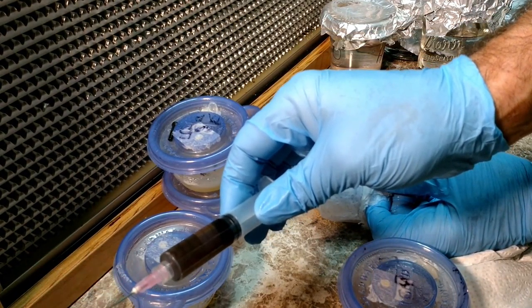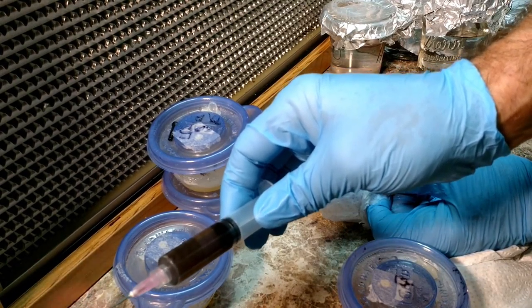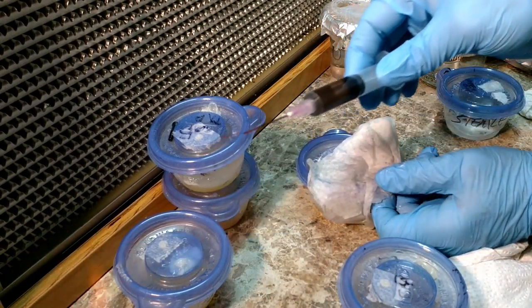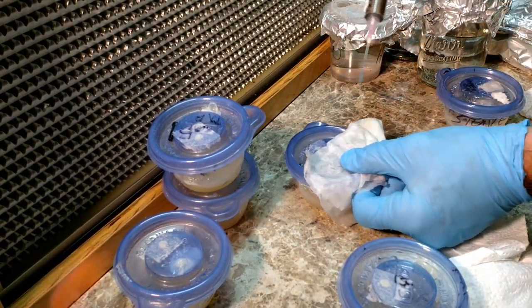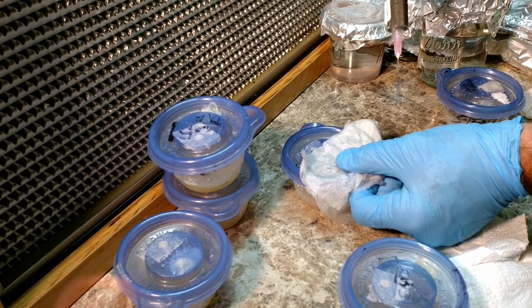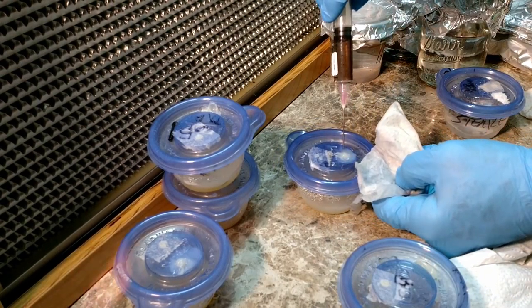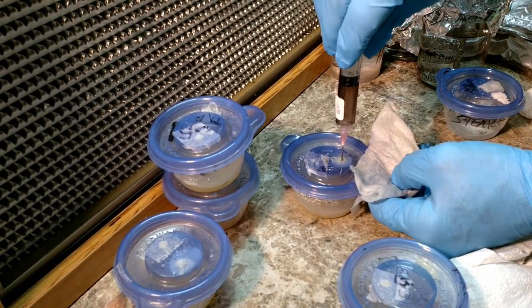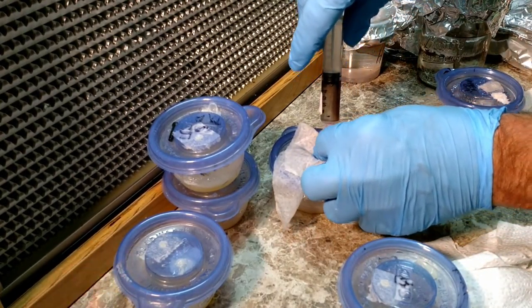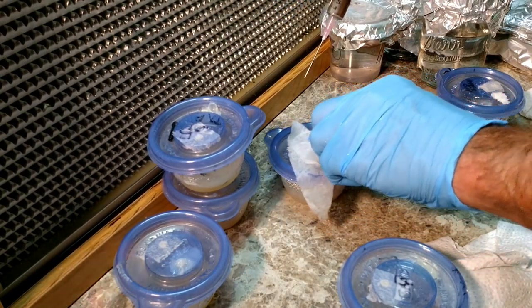I'm going to flame my needle red hot on the tip, work it in a little bit — you can feel it popping. Red hot, pull that out, hold it off, gentle pressure — there we go. Wipe it with the alcohol, straight through, inject a little bit. All that you really see is just that top bit moving. You really can't tell that you're putting in a couple of drops, so you hope for the best, to be quite honest.